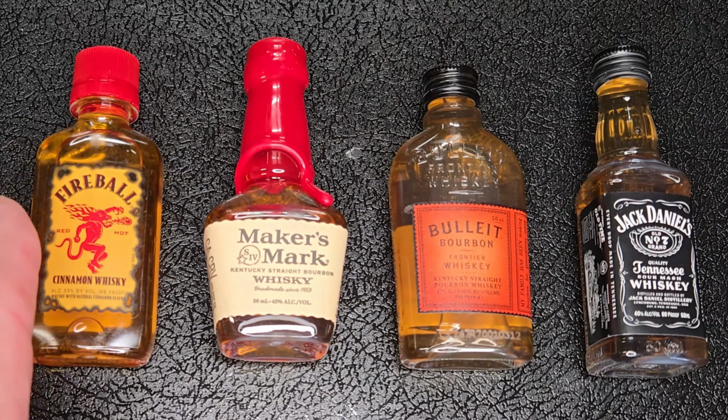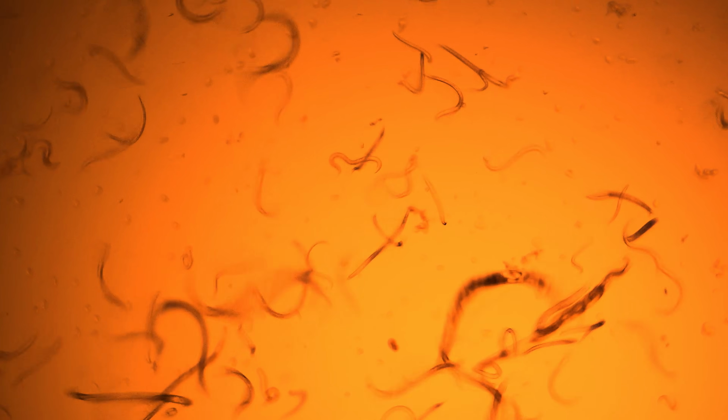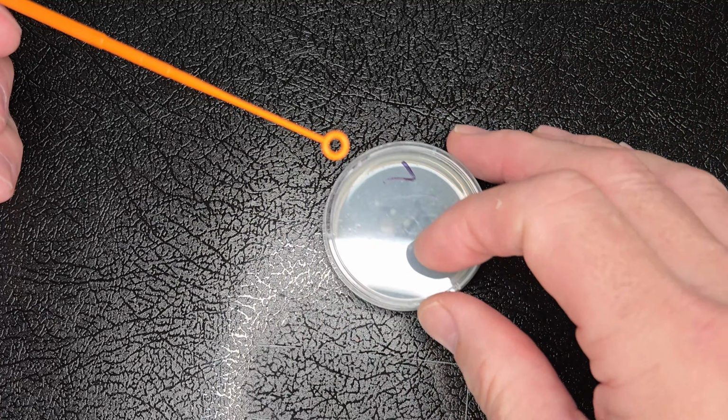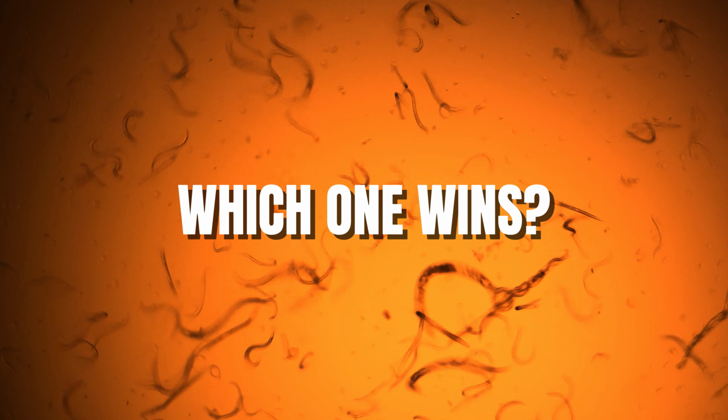4 bottles, 4 very different whiskeys. Today, we're putting every one of them to the test. First, we'll see what they leave behind under the microscope, and then we'll introduce each one to a living nematode and see how they react.